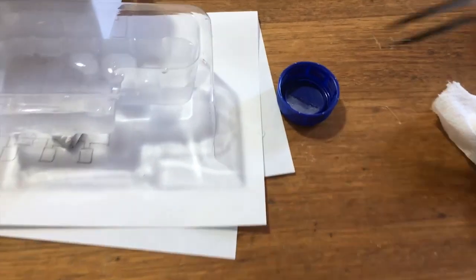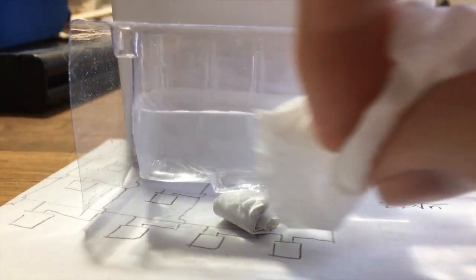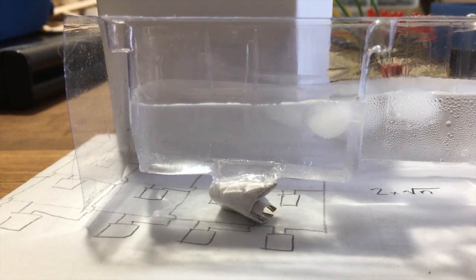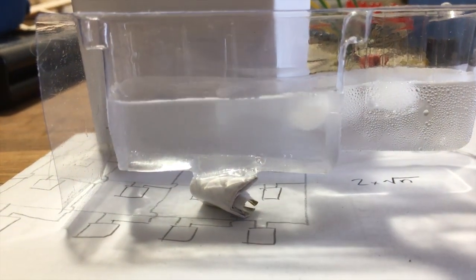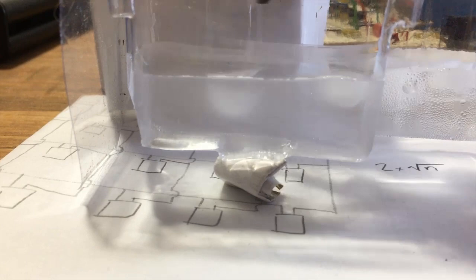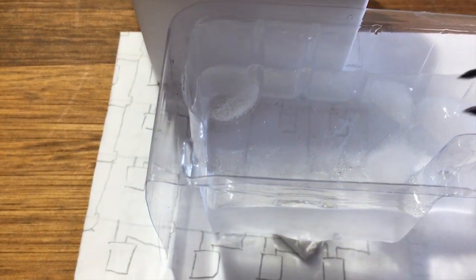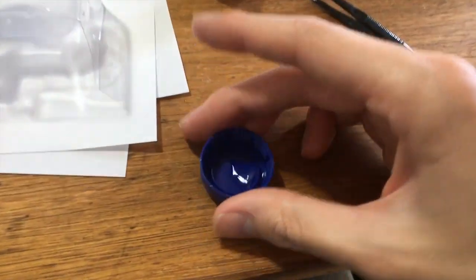In a slightly more controlled setting, here we have the ice cube of heavy water. We've got our water here. Position the camera in the right spot and wipe off any condensation here. We should see if I can pick up the ice cube with the tweezers. The ice cube floats in the water. That's a bit weird. Doesn't seem to want to stay down. Let's get that back out of there, if I can grab it. So that is really weird.